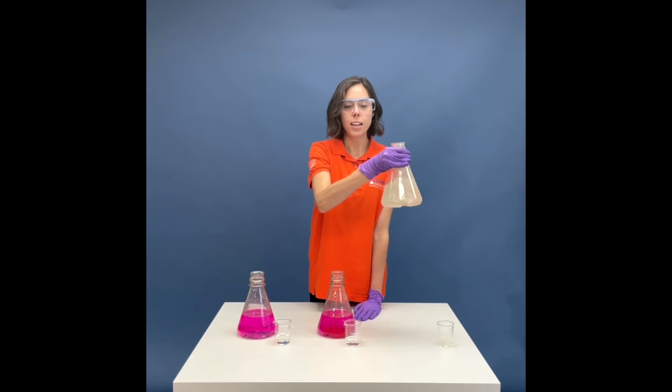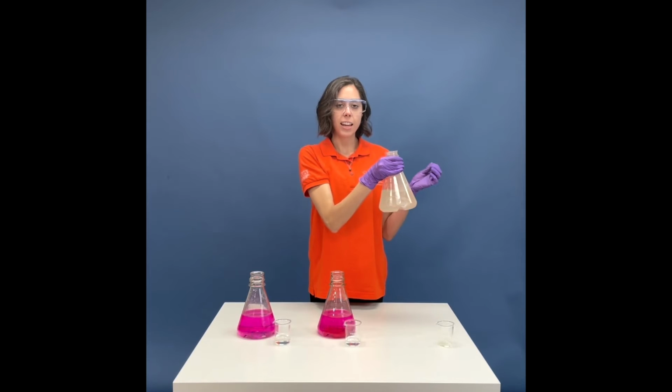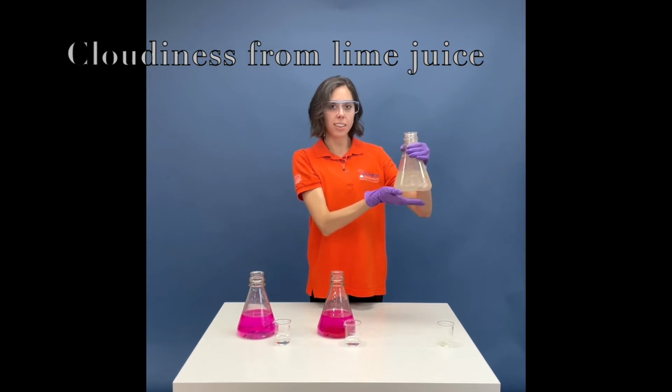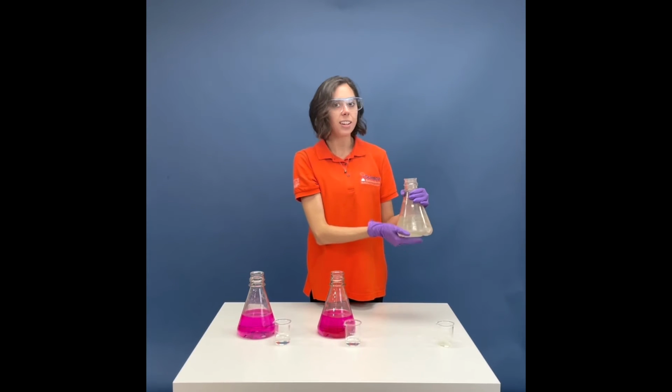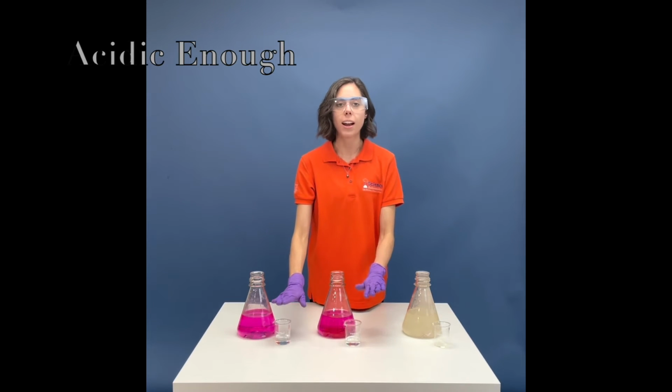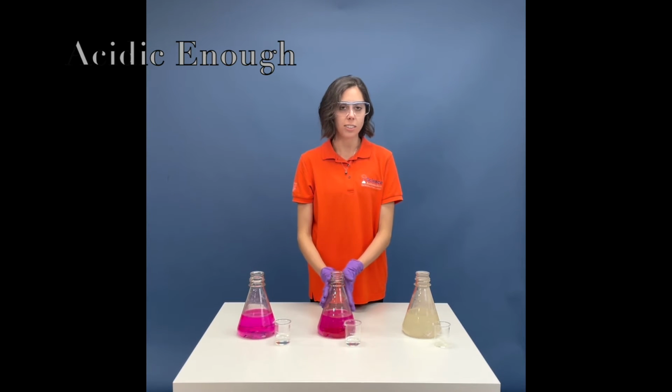As you can see, the color that the phenolphthalein had turned completely clear, which is an indication that we now have an acid.